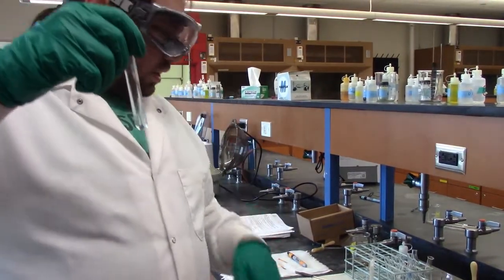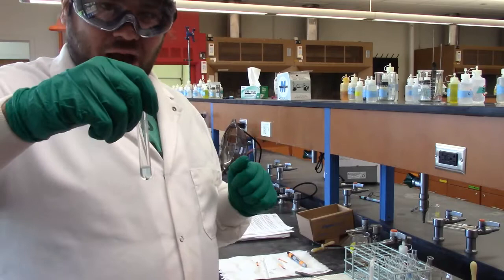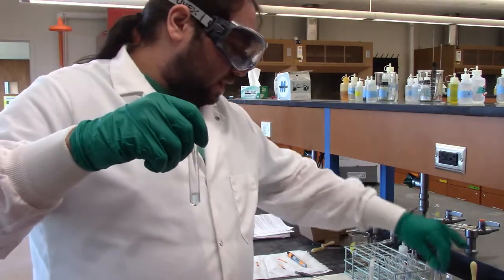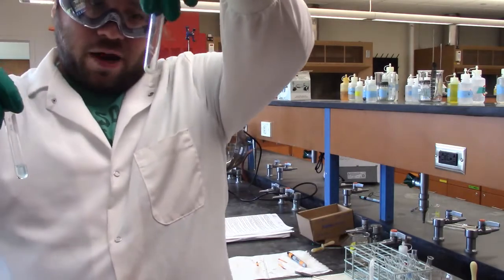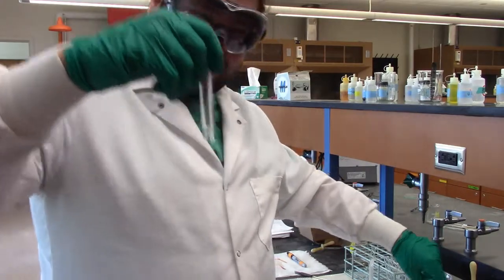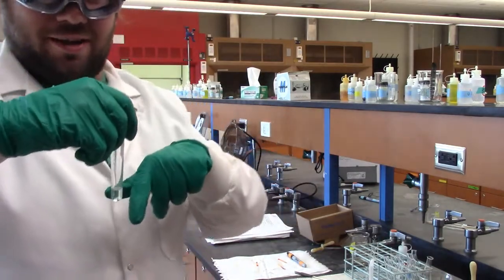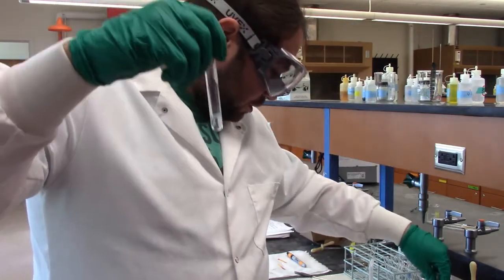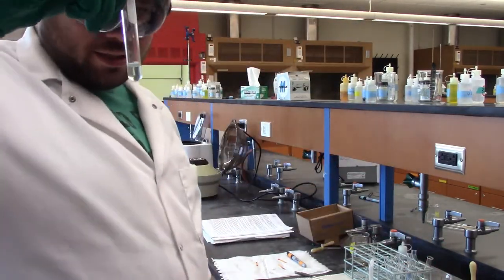Alright, so like we said earlier, we had that white stuff at the bottom. We think that was fused sulfur, which we want to get rid of, so we've decanted that over here. However, upon further inspection, it is quite white, so that might actually be our bismuth. So we'll come back to that and see if the bismuth test works over here or not. If it doesn't work over here, then this is our bismuth. But we're going to try it with this. But first, let's do the rest of the steps to get our copper.